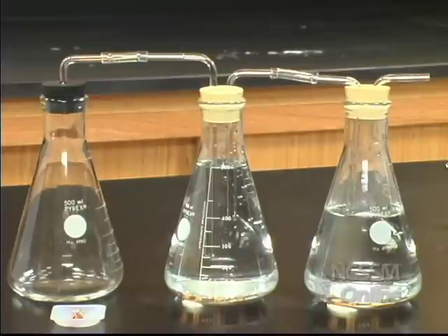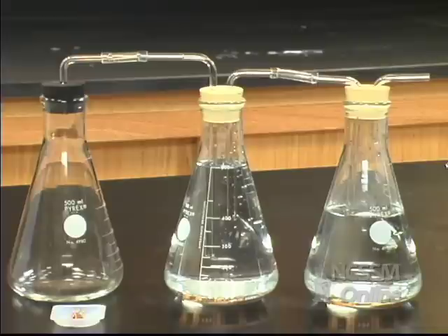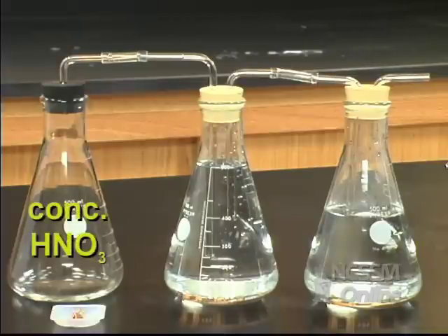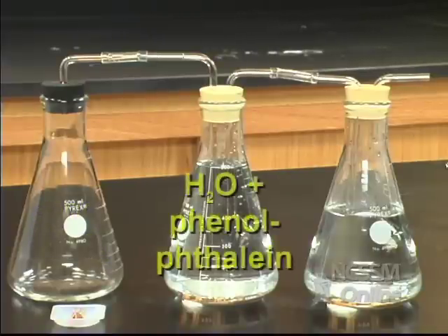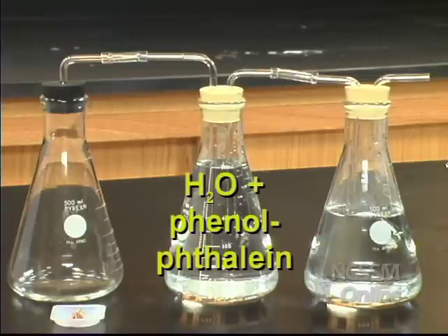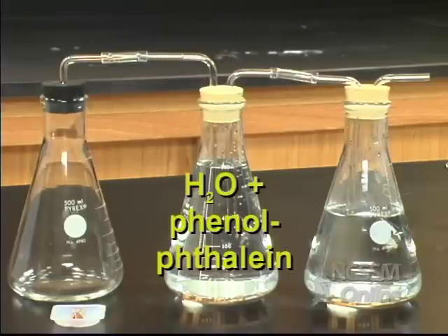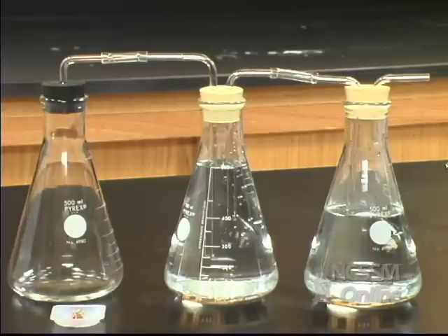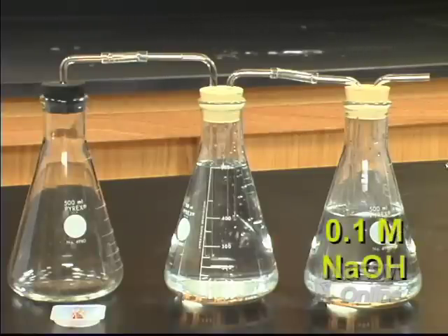What I'd like to do is start out with having us observe a chemical reaction — a reaction between copper metal and nitric acid. In the first flask, we've put in 20 milliliters of concentrated nitric acid. In the second flask, we've put in 500 milliliters of water to which we've added a little bit of phenolphthalein. Phenolphthalein is an acid-base indicator that is colorless in acid solution and pink in basic solution. In the third flask, we've put about 400 milliliters of 0.1 molar sodium hydroxide, which is a base.